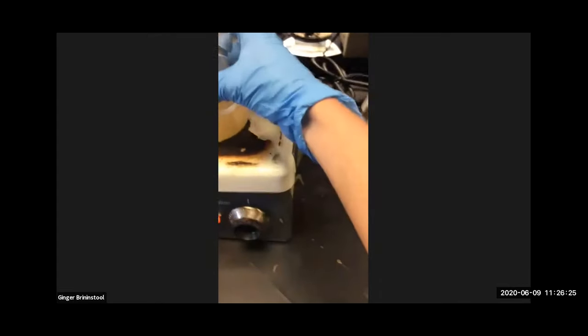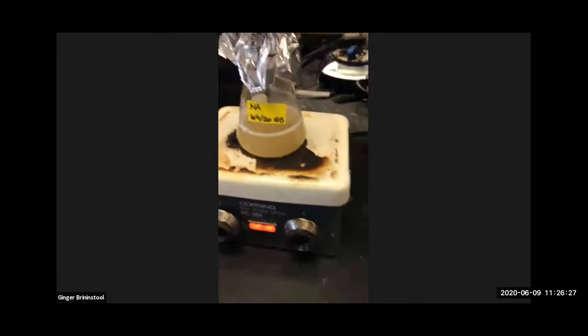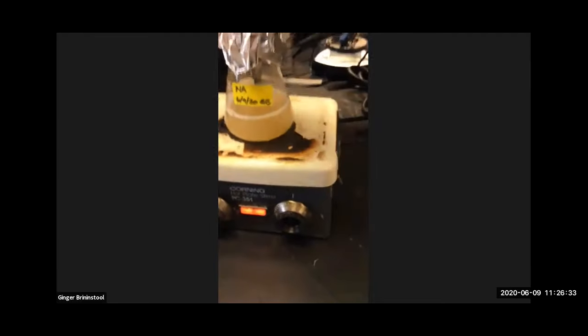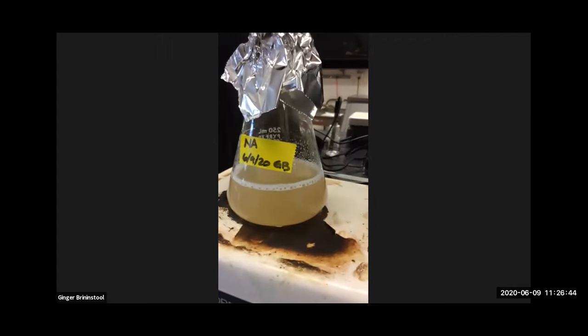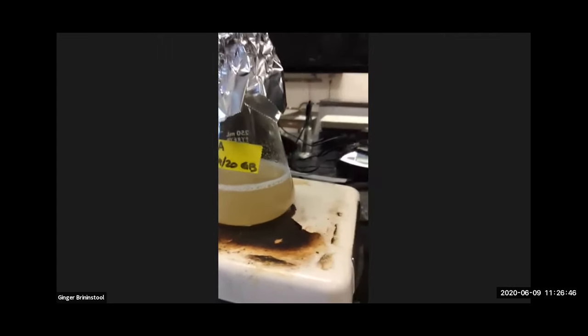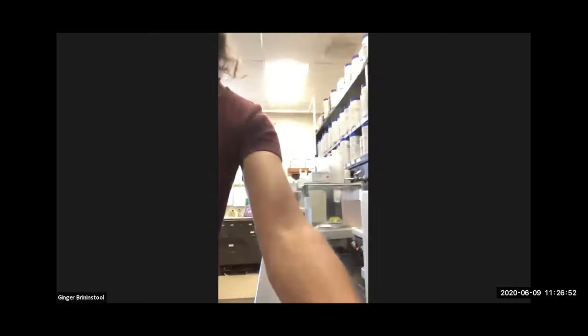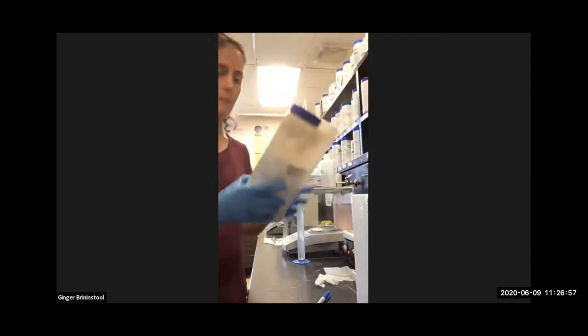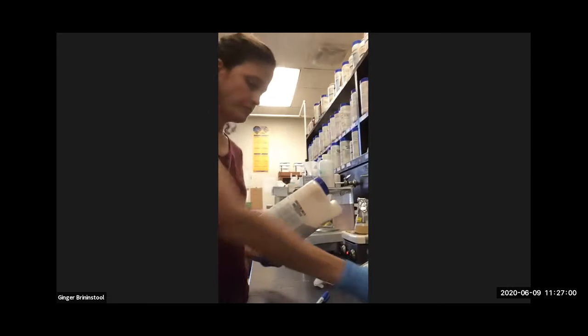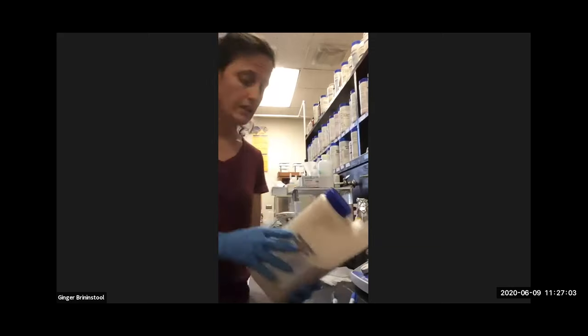It's getting warm, but it's not hot yet. Be careful when you're heating stuff like this, because the hot plate is hot, which means the flask is also going to be getting hot. So handle things with care when you know you're heating them, just like you would if you were in your own kitchen, right? So take a look at that, see it's nice and cloudy and opaque, and that's going to change for us. But in the meantime, while that's doing that, we're going to turn our attention to the nutrient broth, right? So the nutrient broth is a little bit different, similar, but different.